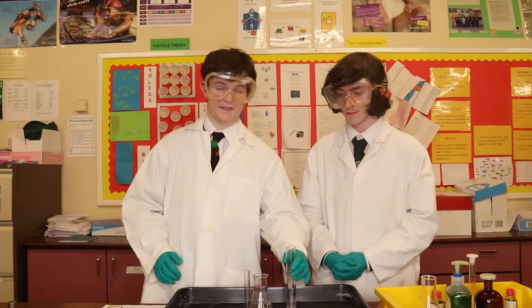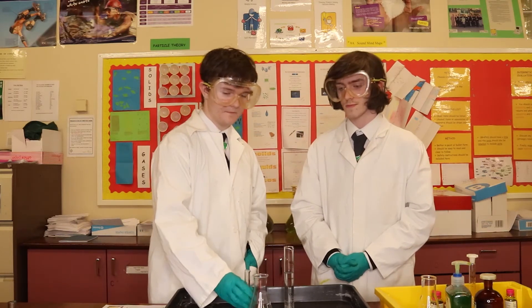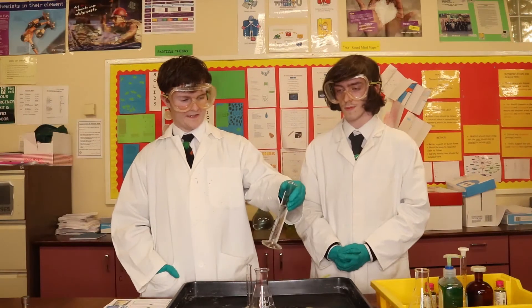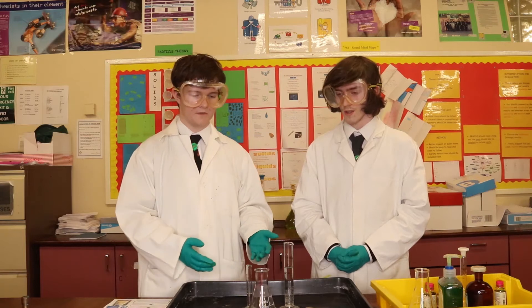Currently we have 50cm³ of hydrogen peroxide as Dylan said, and we also have 5cm³ of potassium iodide. The potassium iodide will act as the catalyst which will speed up the rate of reaction, because as me and Dylan both know, if we didn't do this, this reaction would be a very slow process. As you can already see, this hydrogen peroxide already has gas forming inside it so it's already started to decompose.